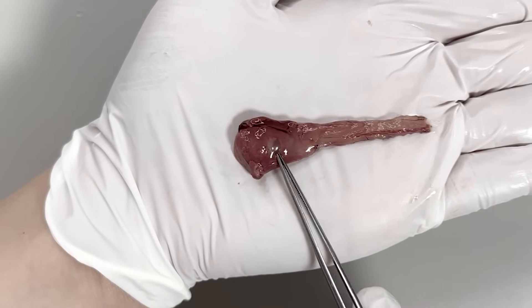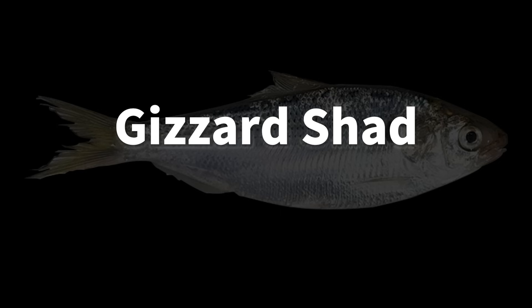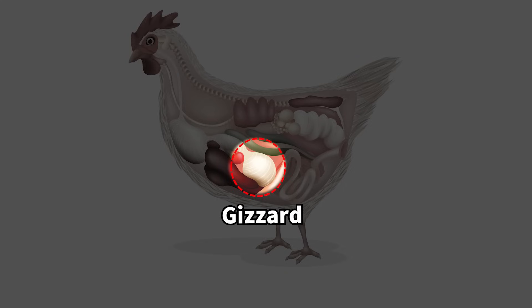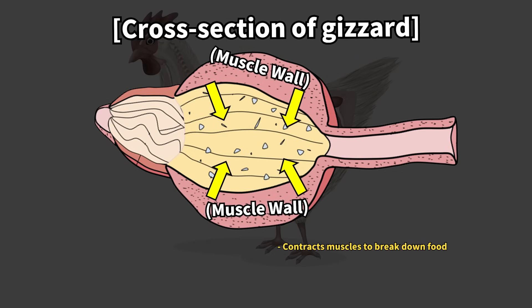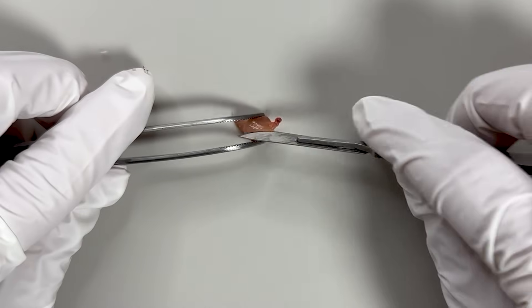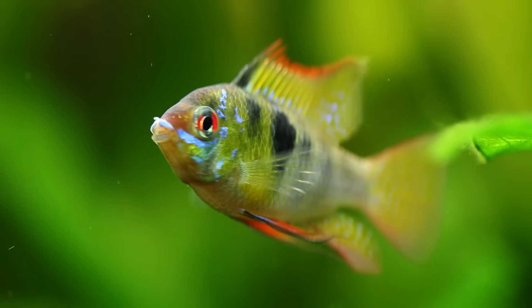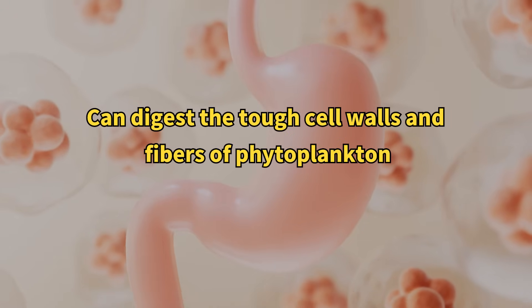Notice here, this slightly whitish part is a very rare organ of the Gizzard Shad. If we remove just this part, you will see a pea-sized organ like this. This is the Gizzard, and its English name, Gizzard Shad, means sandbag herring. The Gizzard Shad is so named because its stomach resembles the gizzard found in the digestive system of birds. The gizzard is composed of thick muscles that help the bird mechanically break down food into smaller pieces. Some birds ingest sand and stones to help grind their hard food into smaller pieces, and these can actually be found in their gizzards. We cut open the Gizzard Shad's gizzard to see if it contained sand, but it did not. Unlike the stomachs of other fish, which digest food enzymatically, the Gizzard Shad's stomach is muscular and mechanically crushes the food, making it easier to digest tough food.